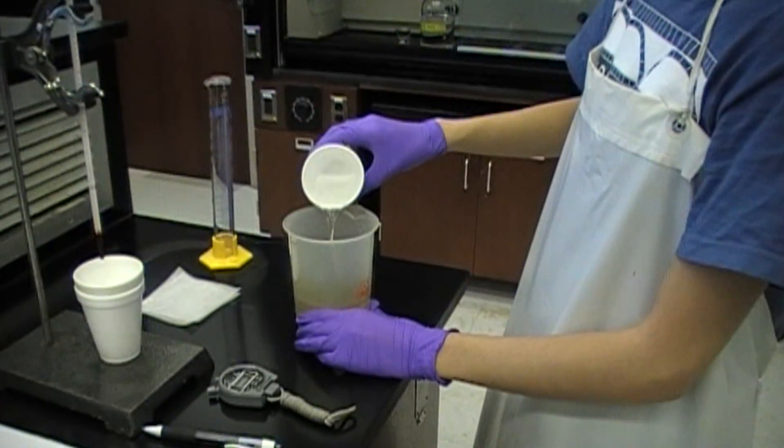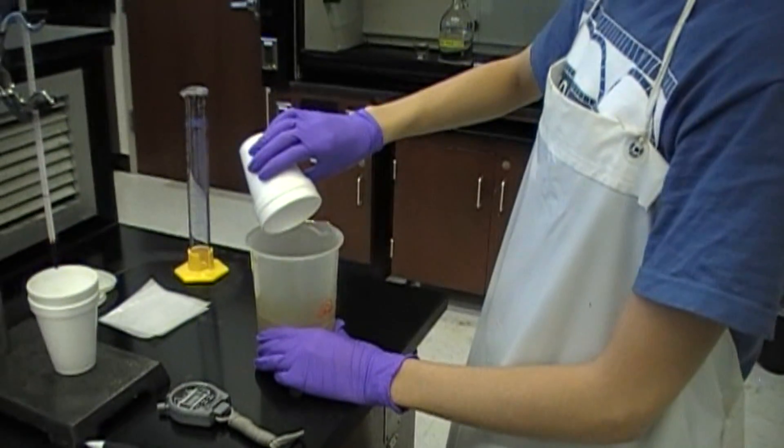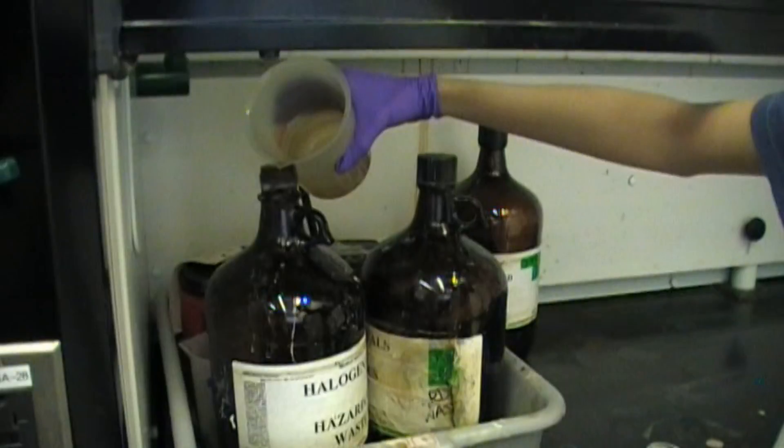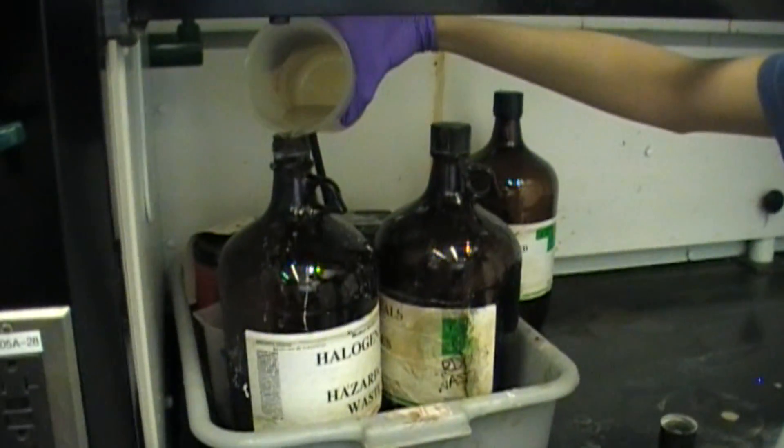Overall, after you have finished your experimentation, make sure to dispose all of your solutions in the waste beaker into the halogenated waste container.